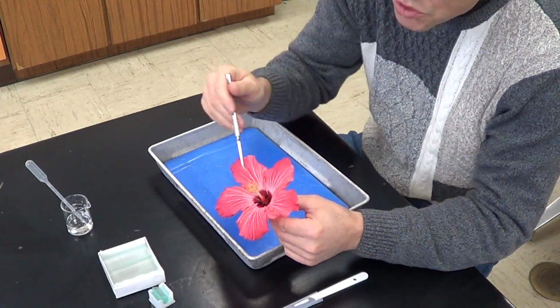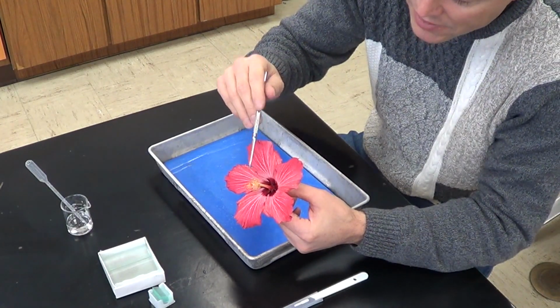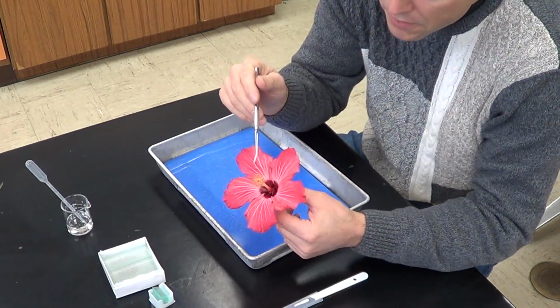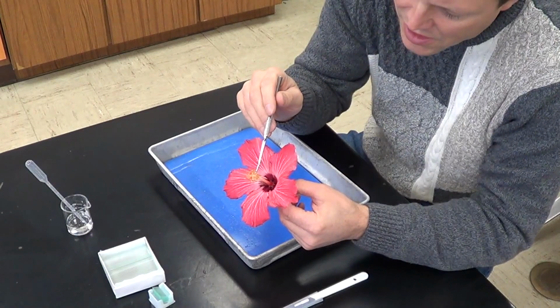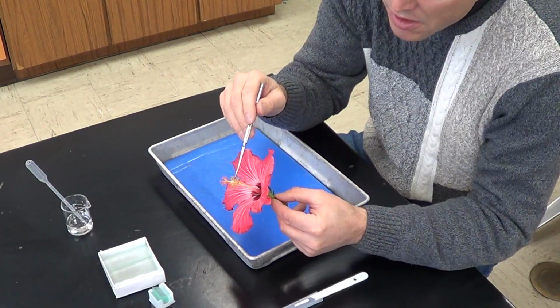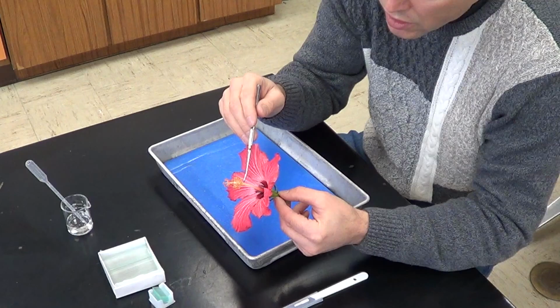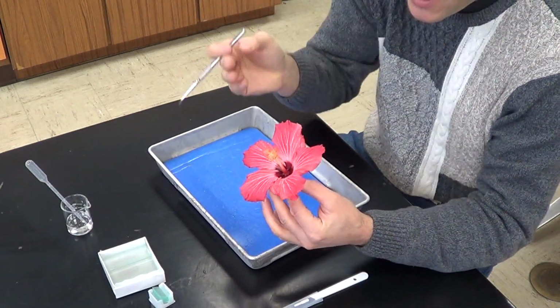Now let's look at the next whorl, which is going to be this right here. And these again are modified leaves. And this is going to be the male part of a flower. Now the male part of the flower is referred to as the stamen. And the yellow structures on the end are called anthers. And these anthers are held up in the air by this long wire-looking structure called a filament. And that filament helps hold the anther up high.